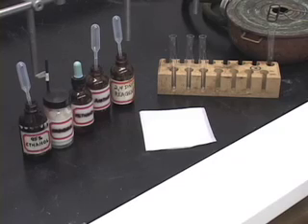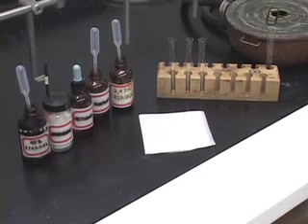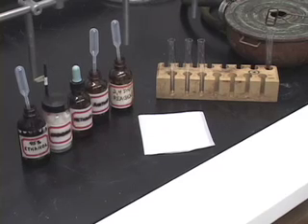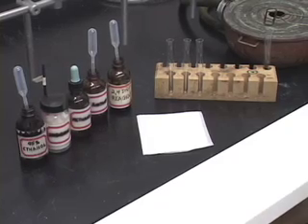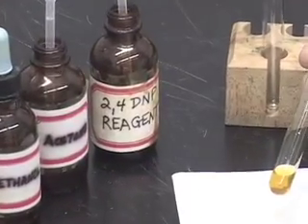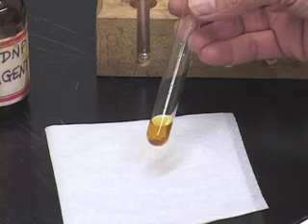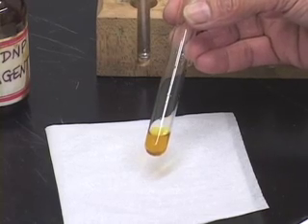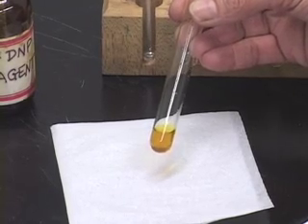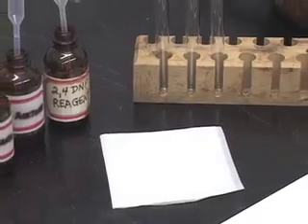The 2,4-dinitrophenylhydrazine test, or 2,4-DNP test, is done to test for the presence of ketone and aldehyde functional groups. When you add 2,4-DNP reagent, which is a yellow-brown liquid, to a compound that has a ketone or an aldehyde functional group, you get a precipitate ranging in color from yellow to red, confirming the presence of that functional group.